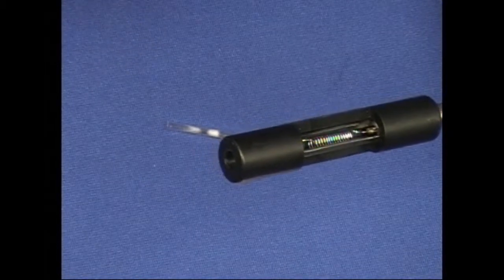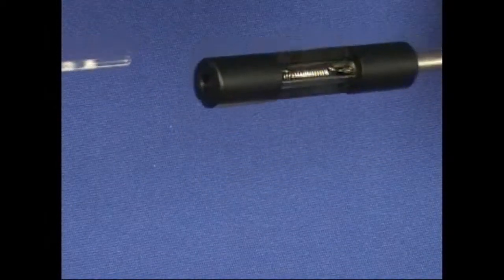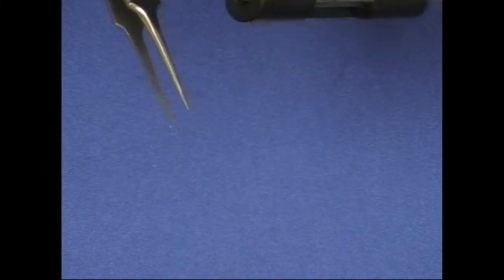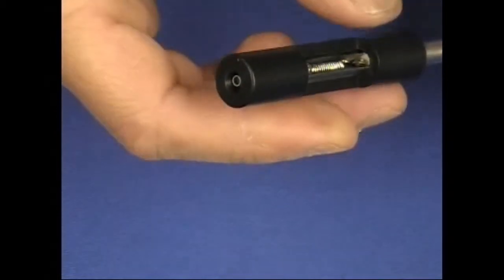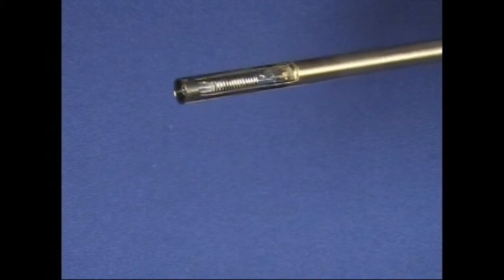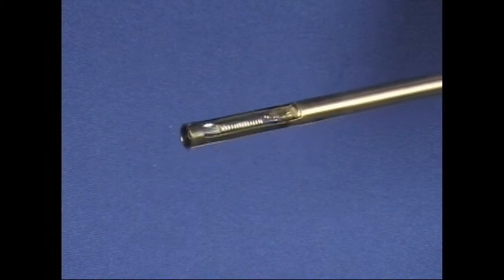and then you pick up the tube, and it goes into the end and just drops in. And then when you remove this, the quartz tube is inside the coil of the probe. It slides right in because the bottom of the tube is fire polished.